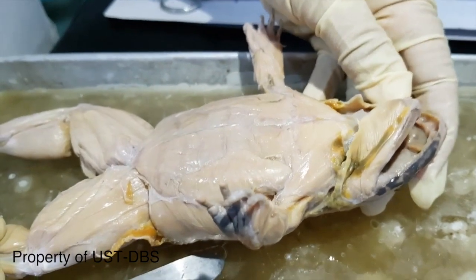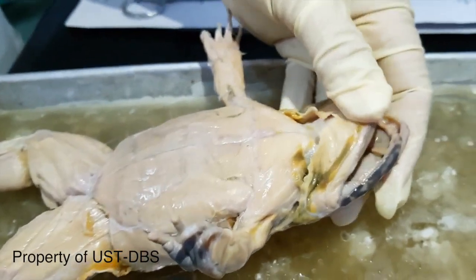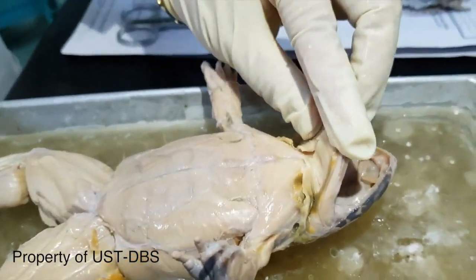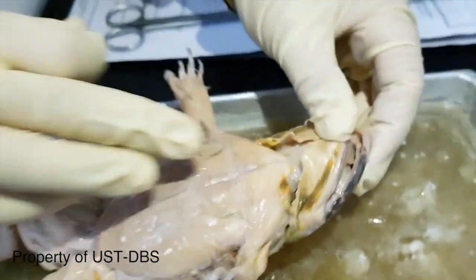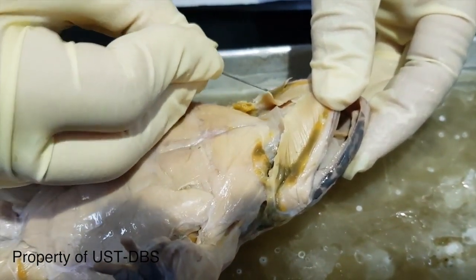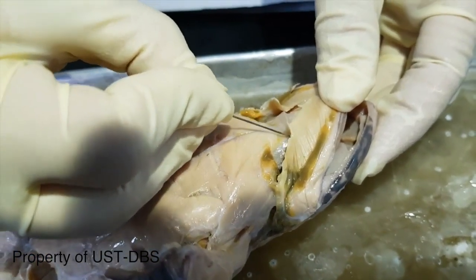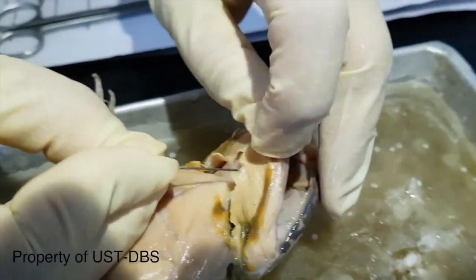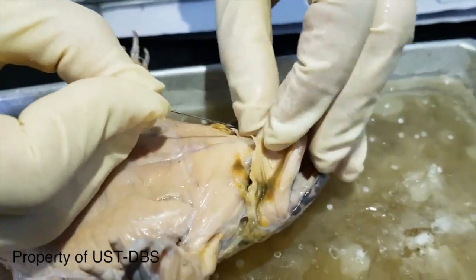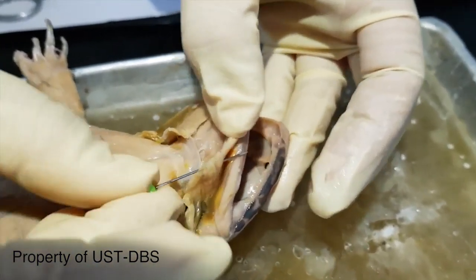Okay, so we'll start identifying muscles on the ventral side. I already cut some of the muscles, and we're going to start with the muscle just below the jaw. This muscle here with the striations that runs from the edge of the jaw is the mylohyoid. You're just going to cut it from this portion down to reveal the underlying muscles. I'll pin this one here on the side.